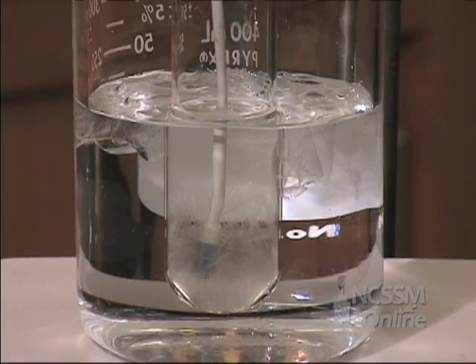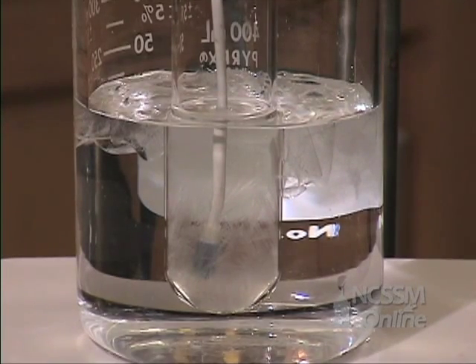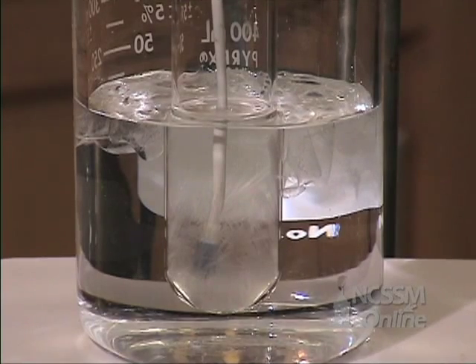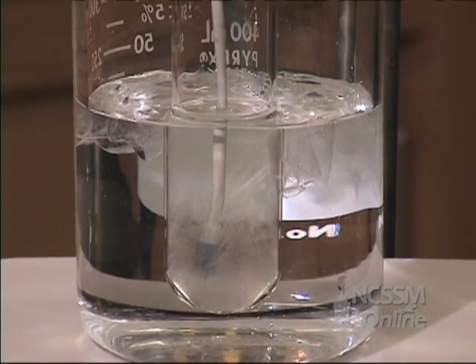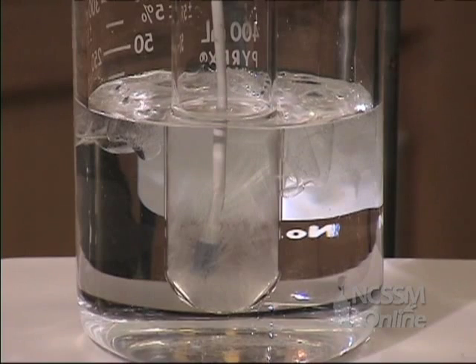The temperature falls until we reach the freezing point. The temperature will then level off at the freezing point until the sample is completely solidified.